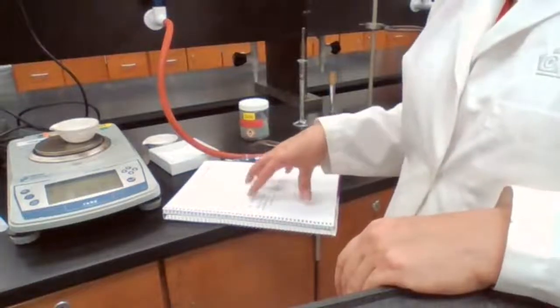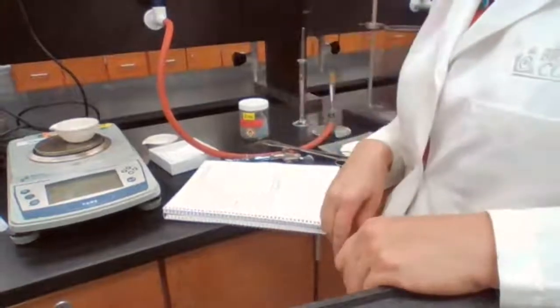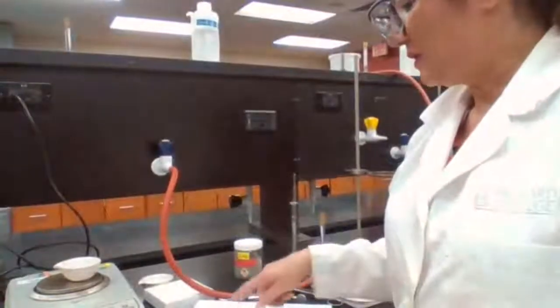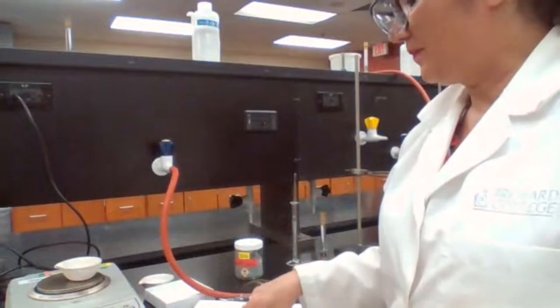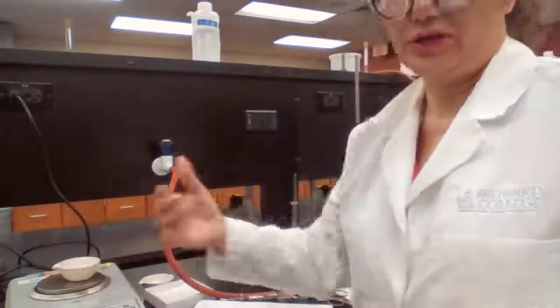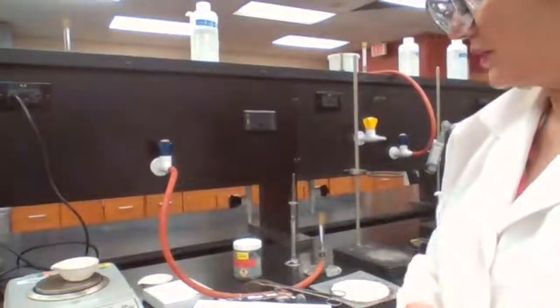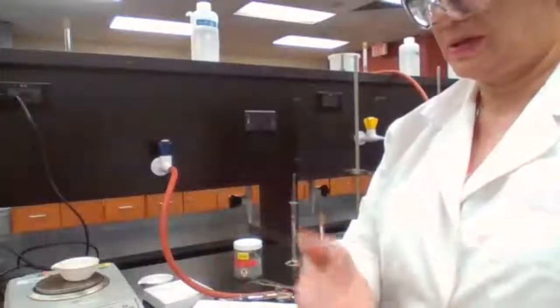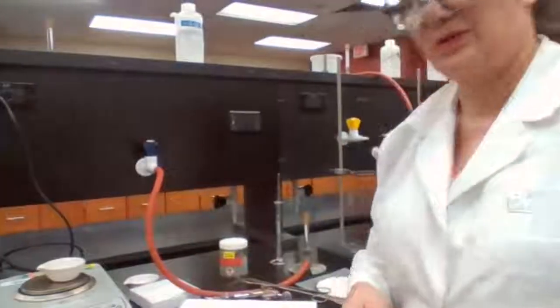But the information to be collected in the lab are those numbers that I already typed in the chat area. Also, I said it, so you can record those numbers. And also the description of the appearance: because it's a white powder, as I showed you, you can record your observation as white powder. That's what you have. Okay, we are done with experiment 3.